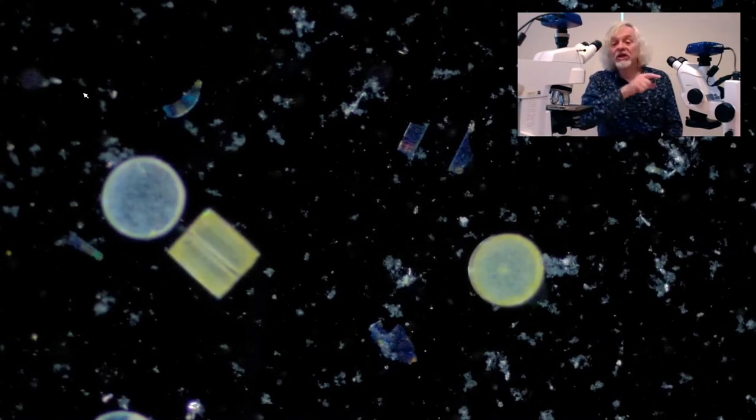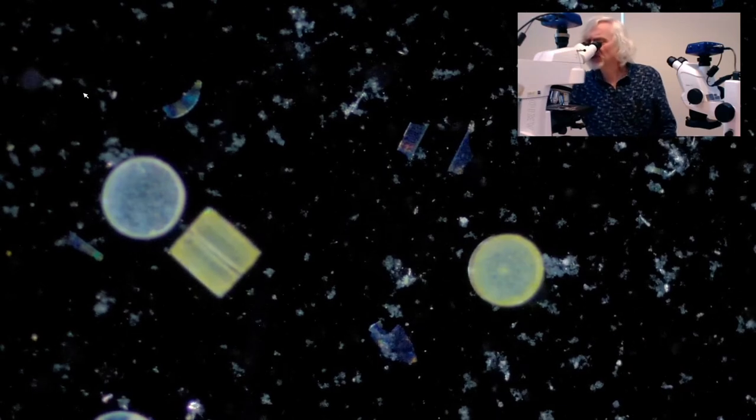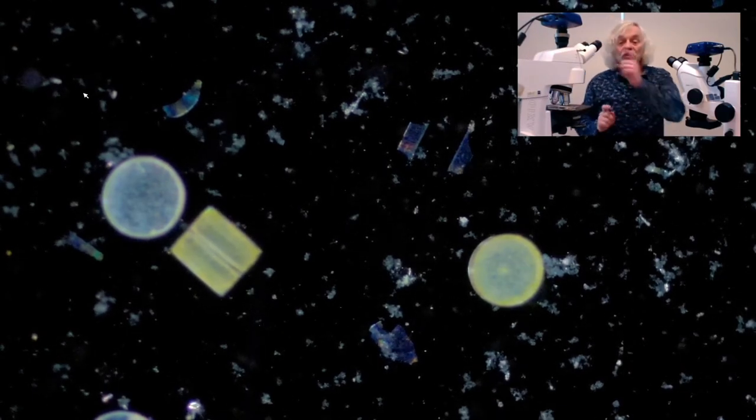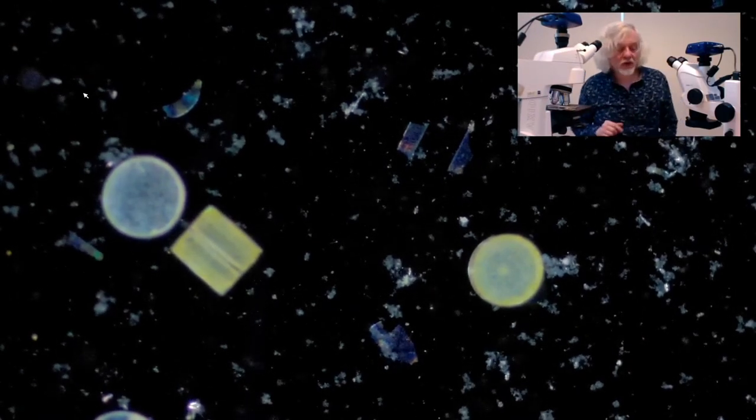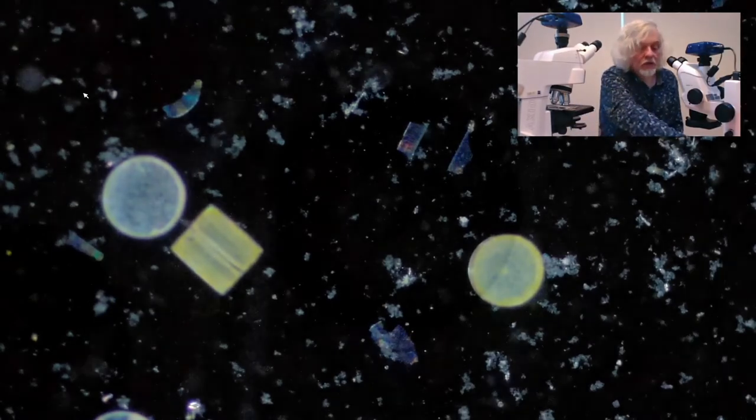Now what you really need to do is jump to a much higher magnification. So that's what I'm going to do. I'm going to switch from this microscope to this one and show you one up really close.